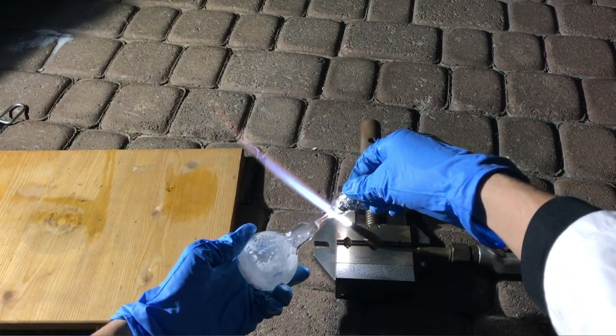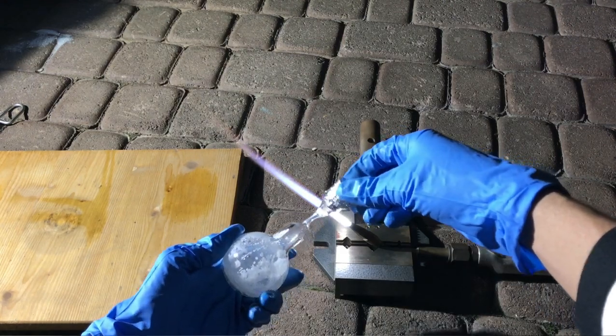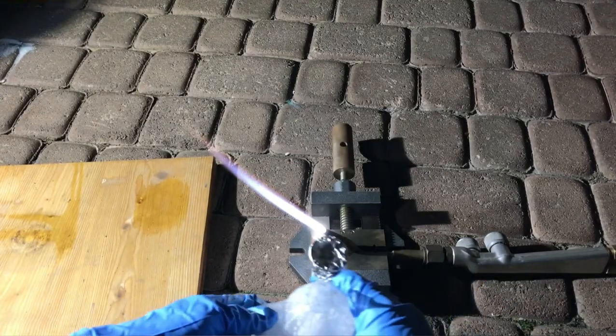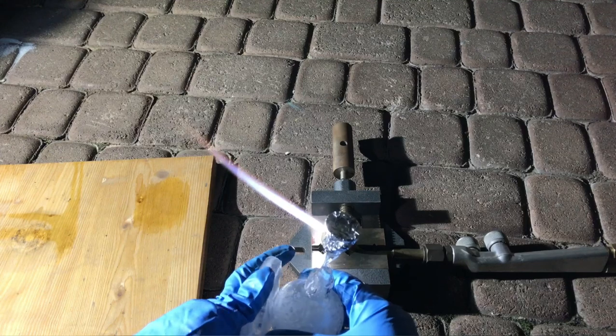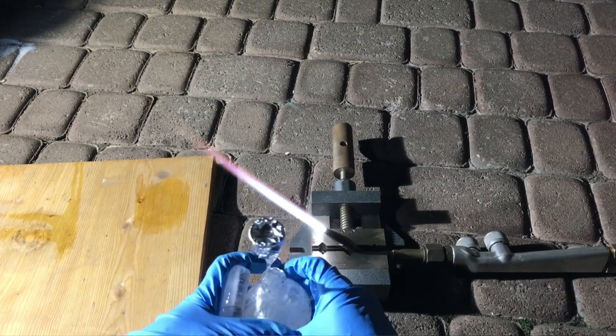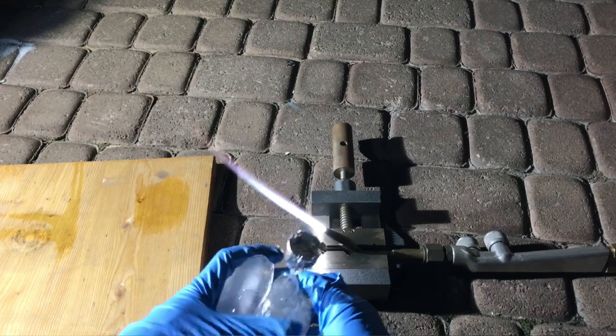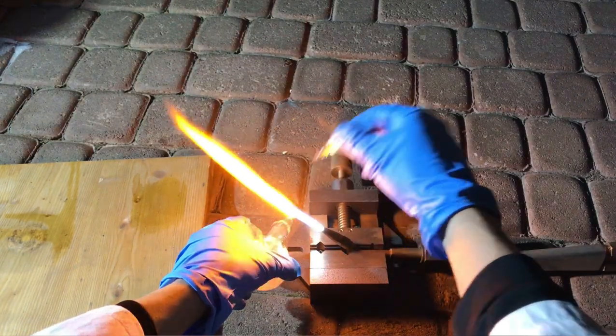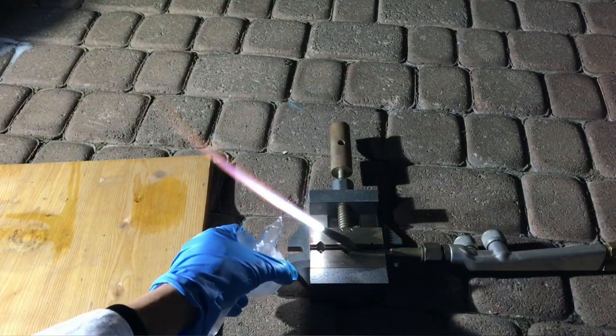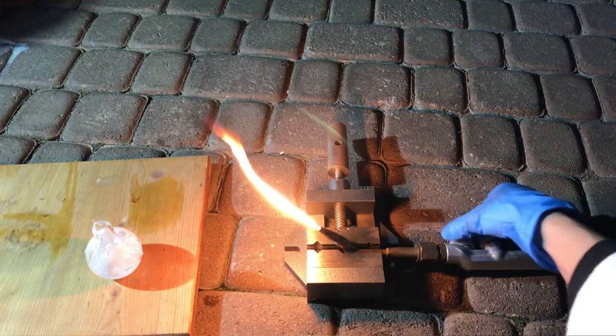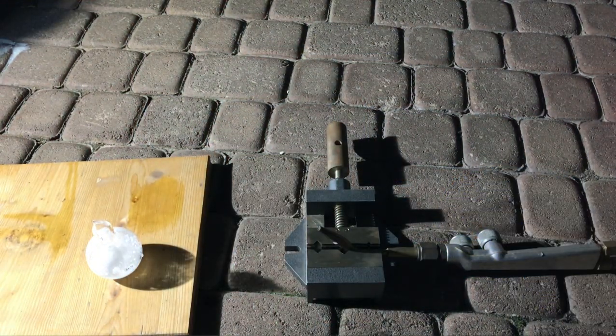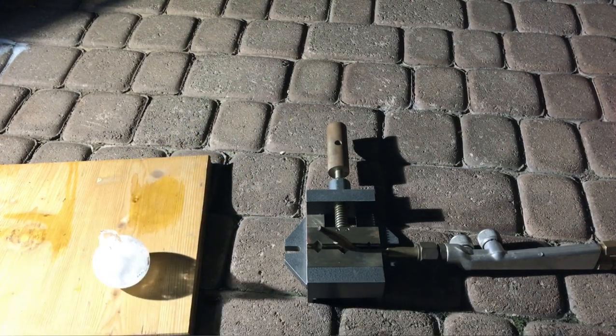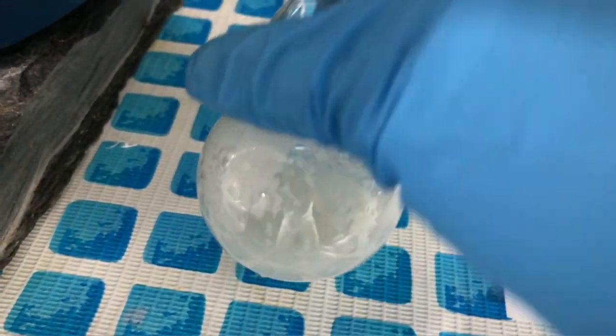The neck was first off stretched out just a little bit to make it thinner. We wanted to make sure that this ampoule is really well sealed and therefore we cooled it down using some ice. The air will be cooled down and it will contract. The ampoule can be sealed more efficiently. There will be no bubbles in the glass stemming from expanding air. The ampoule was put aside and it was allowed to cool down. And there you go, a nice and perfectly sealed ampoule of sulfur trioxide. With the second ampoule we won't be as lucky.